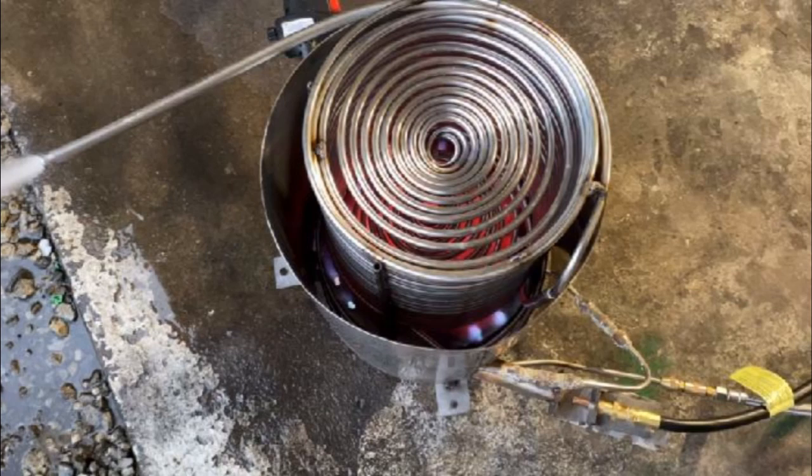Here in the bottom right-hand corner we can see the injection nozzle, and I outlined the position I had in this test with a marker. So you should just be able to bolt that propane nozzle right back into place. Just above that and right next to it you can see where the water line is connected — that's what the silver stainless steel braided hose is for. You want to give that thing about a half turn after you've hand tightened it. You don't want to over-tighten those stainless steel braided hoses too much.